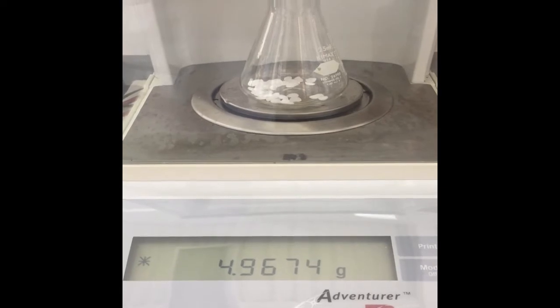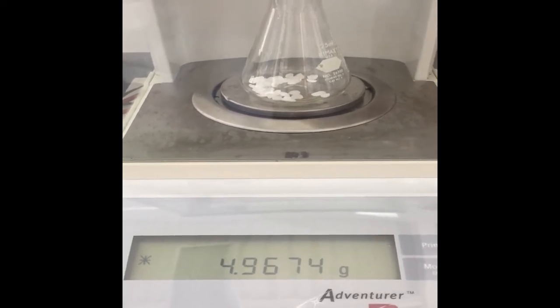Now I need 5 grams of sodium hydroxide and I think I've got that pretty darn close. Swirling this sodium hydroxide until it dissolves in like 25 mils of water. Swirly, swirly, swirly, get that stuff dissolving.